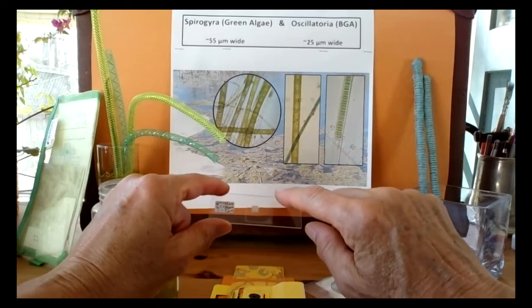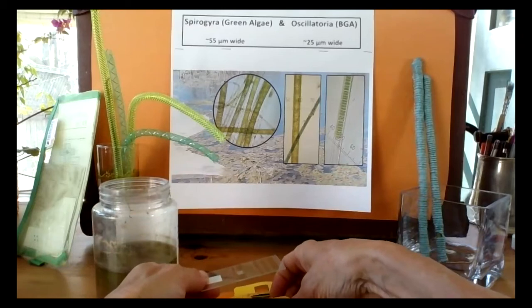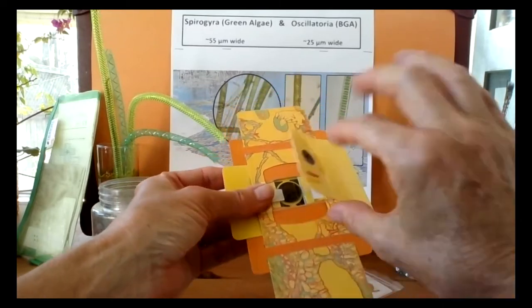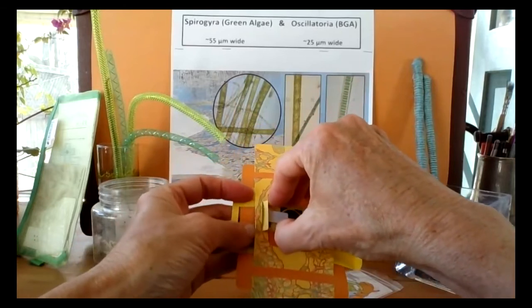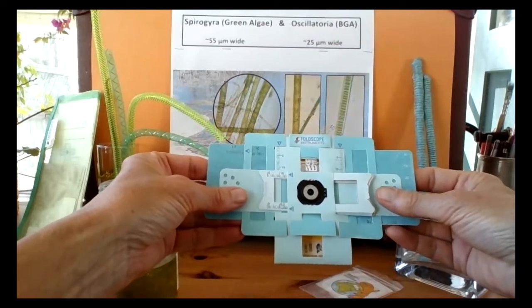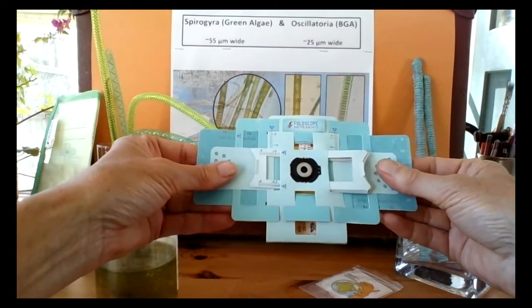So the cover glass slip is the top side of your slide. You flip it over because you're putting it on the bottom side of your foldscope, and you insert it into the tabbed area one side, and then pull up the tab and insert it into the other side. On the other side, you place your thumbs on the perforated paper, and that enables you to move the stage essentially, left and right, and up and down.